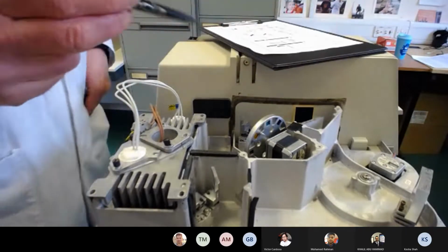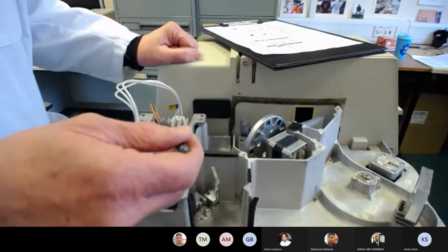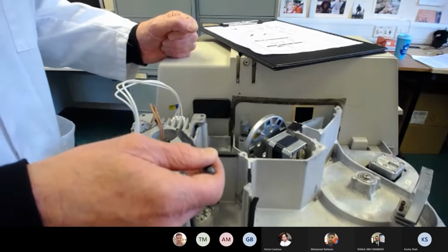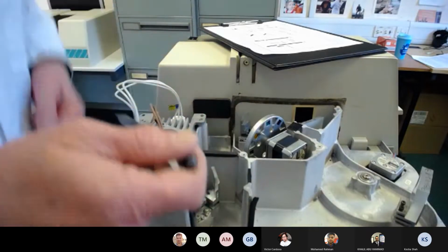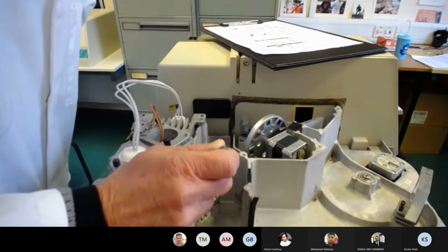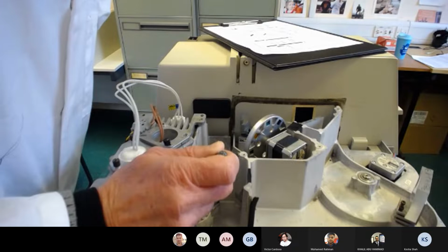Right, so basically you've got your two lamps inside here, and depending on what wavelength you choose on the settings, or if you're doing a scan, there'll be a mirror which diverts light either from the tungsten light source or from the deuterium light source coming out of this point here. Just shout if you can't see anything, okay? That means you can unmute, folks. I don't mind you being unmuted here.